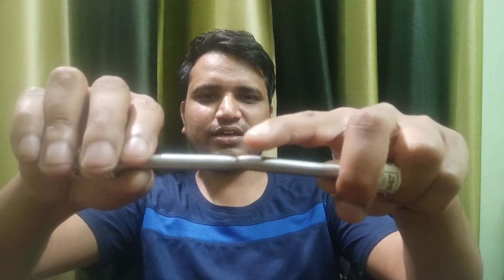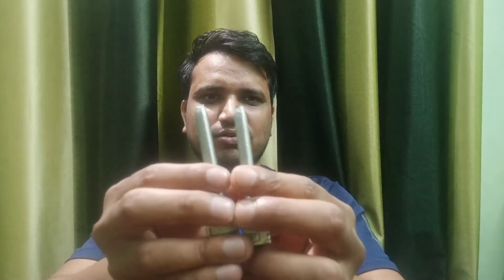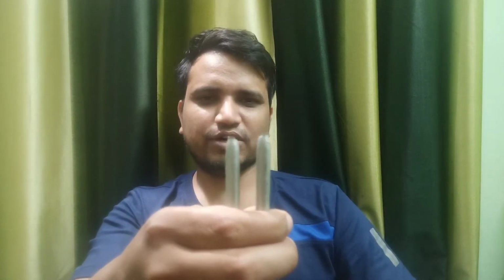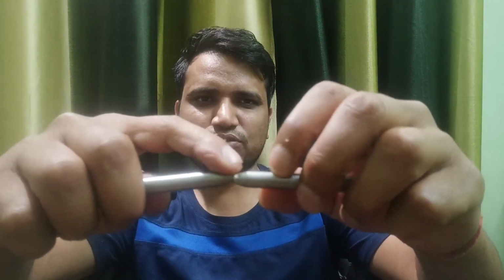During the necking, the diameter decreases, and the presence of this necking also shows that this material was somewhat ductile. If the material were brittle, the necking portion would be very small, or it would not show a decrease in the diameter, because it would fracture from that location without any appreciable amount of ductility. But this is not as ductile as some very ductile material like copper or aluminum. You can see the decrease is there, but it is not comparable with copper. I don't have the copper sample right now, but you can see images on the internet.